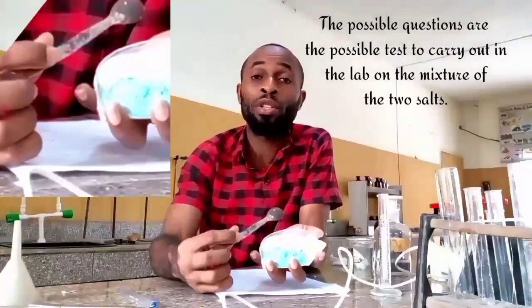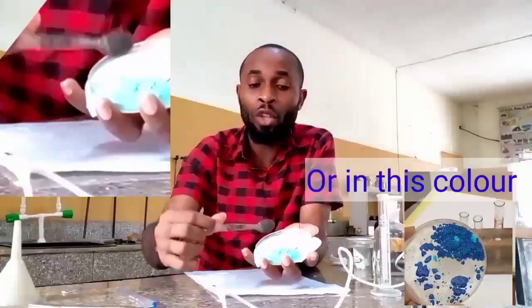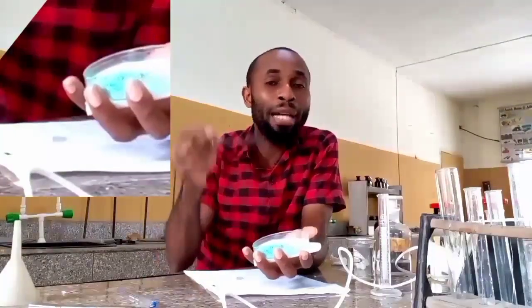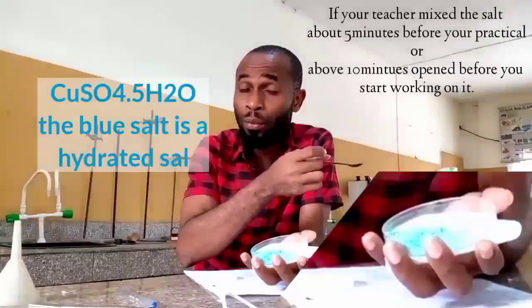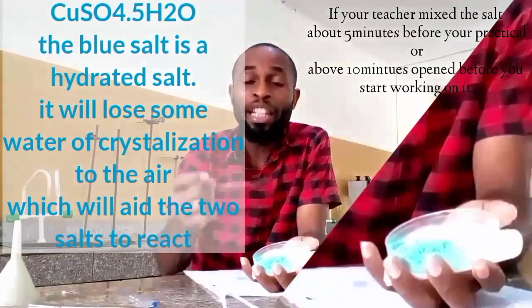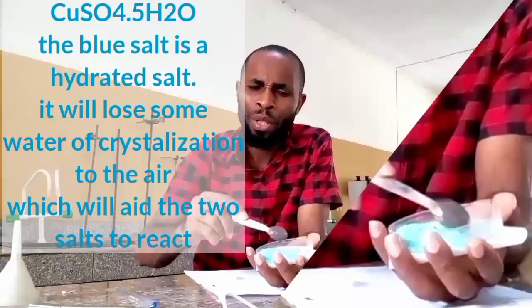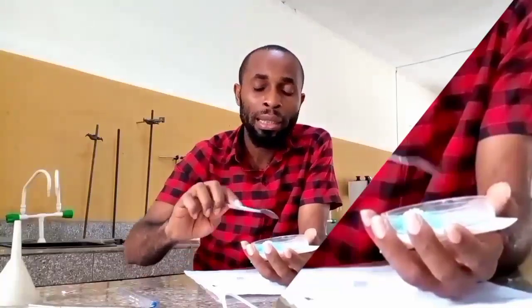Now, your teacher might present this in this form for you. Towards the ending of this video, we will start to react with this, because remember I told you before that this has water of crystallization, and that is the copper. The copper sulfate has water of crystallization, and it is efflorescent. If you leave it for a longer time, it's going to be evolving water, and when it evolves water, it's supposed to react with this ammonium carbonate. The reaction will start. If at the end of this video we notice that, that's good. If you do not notice it, there is no problem.